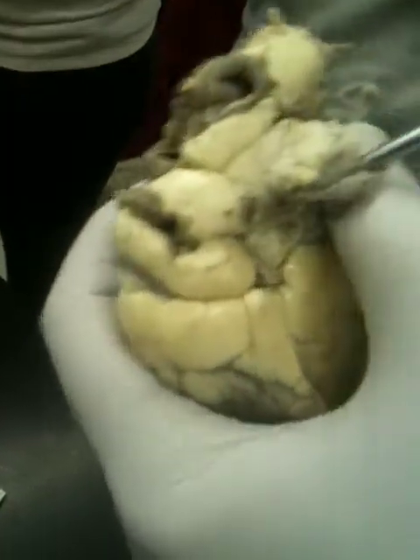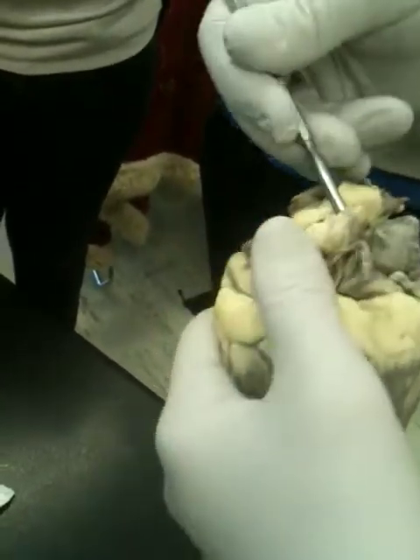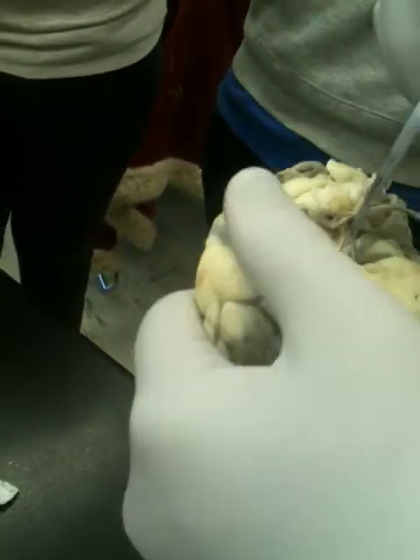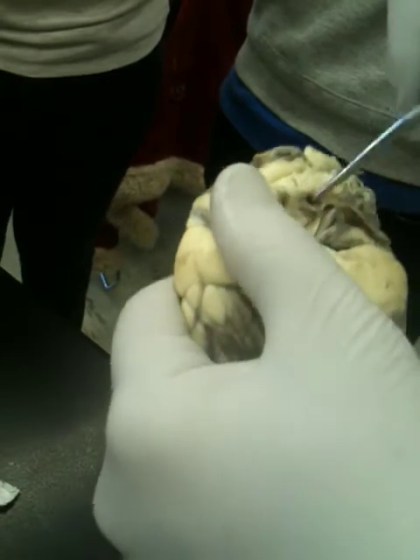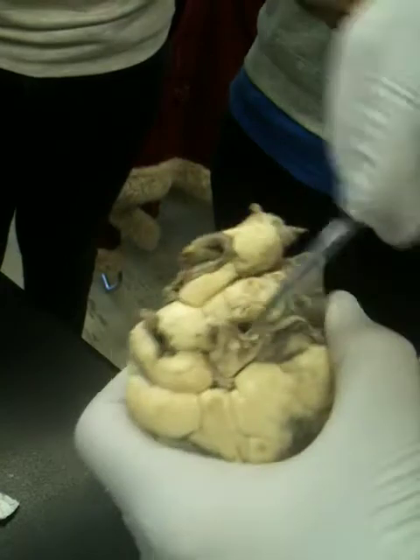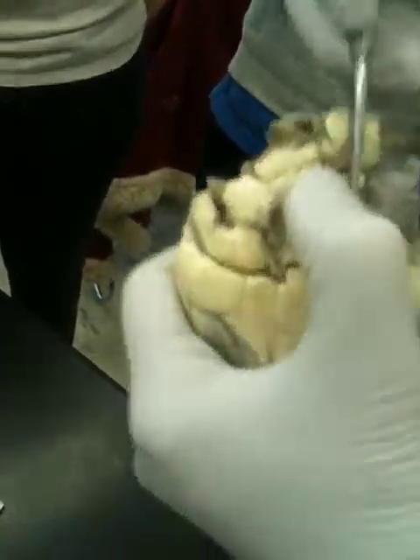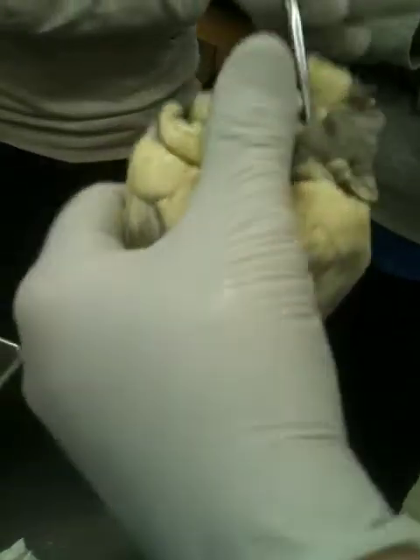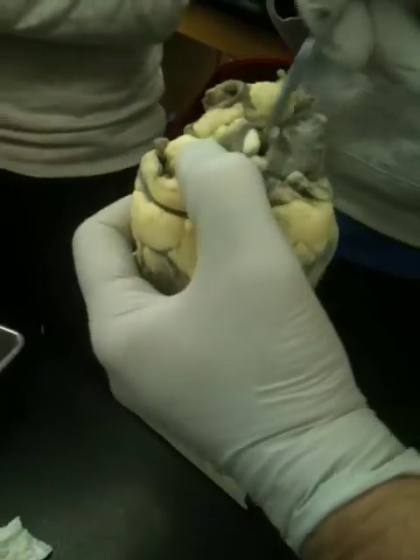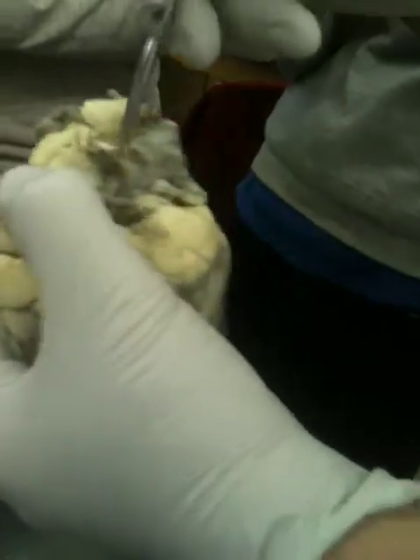On the right side of the heart, there's got to be a big jagged hole here somewhere. Well, there's a hole. That's one of it. And let's see what we can find. There's a hole there. That's probably a pulmonary vein heading over there. But you could see part of it, at least the superior vena cava right there, going into the right-hand side. I don't see another hole, so I guess they both connected right there. The superior and the inferior. Yeah. So that's the right-hand side.